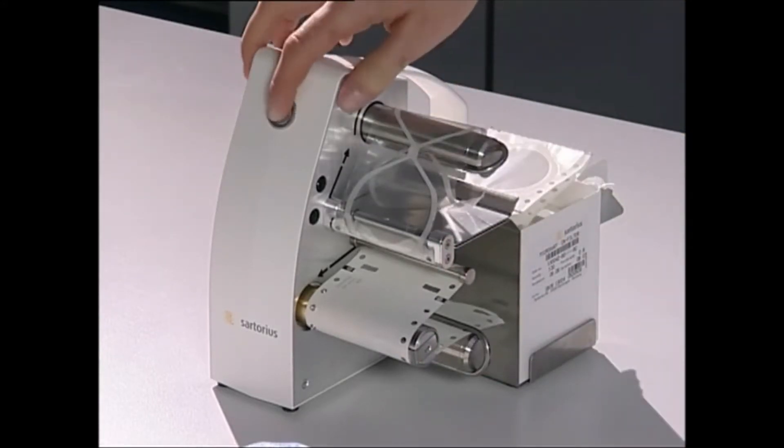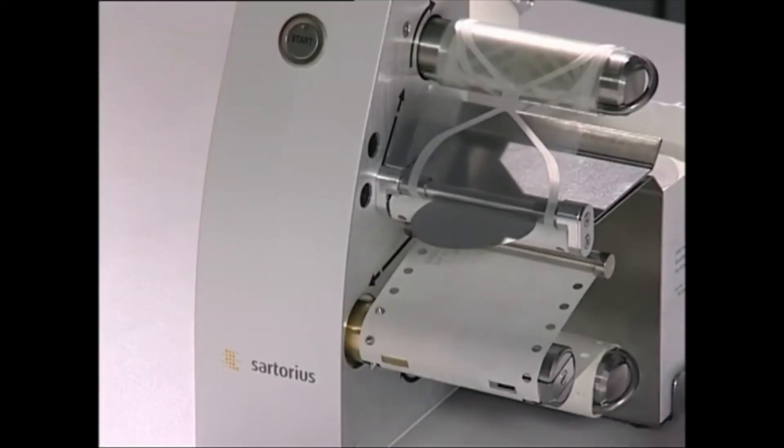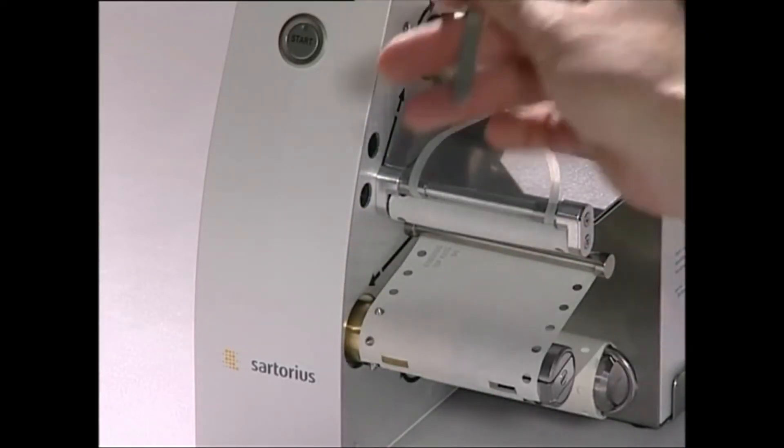Switch on the microsart emotion, and every time you press the start button, another membrane filter will be dispensed. Alternatively, hold the tweezers near the optical sensor to have a membrane filter dispensed automatically.